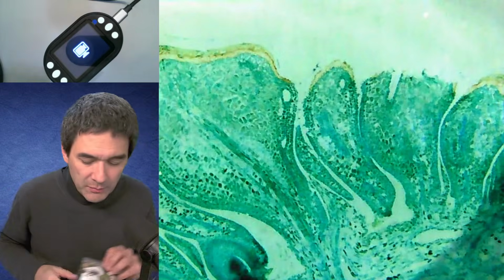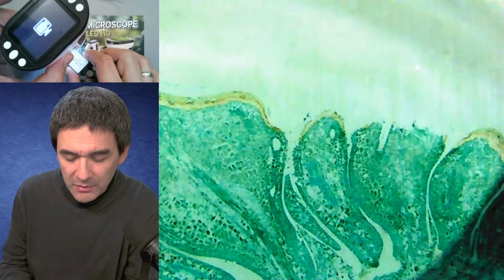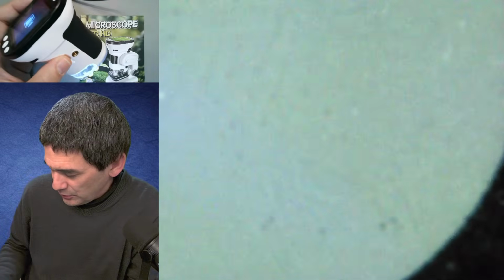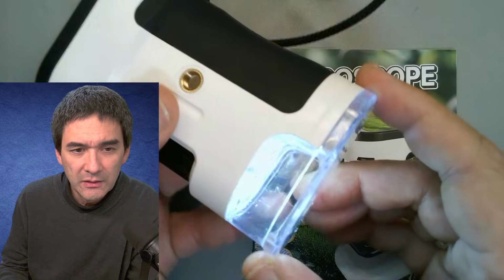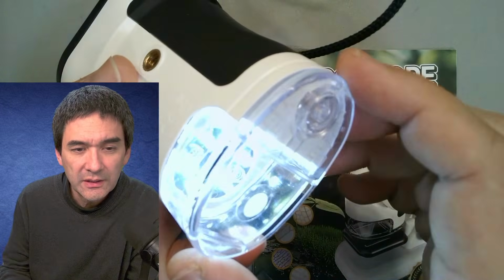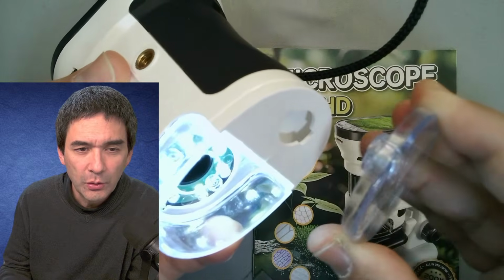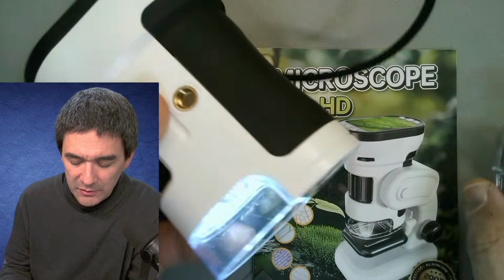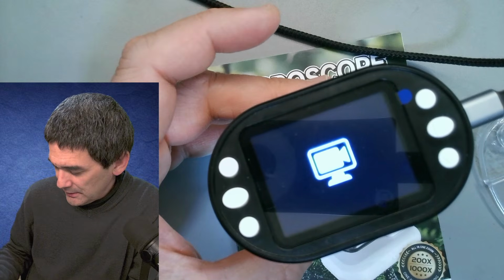I'll just use the instruction manual over here. Because what you can do, and I'm going to show this to you, is we can actually rotate this here. Look here, you see it better. This is basically the slit where you can insert the slide. If you rotate this 90 degrees, you can actually take it off. And then it's flat, and you can put it down. And then you're, of course, able to see the objects like this.